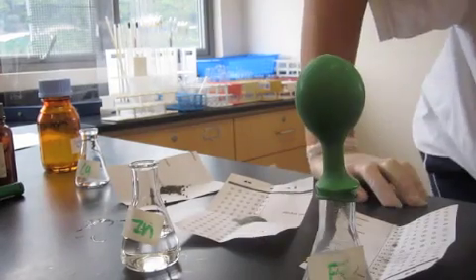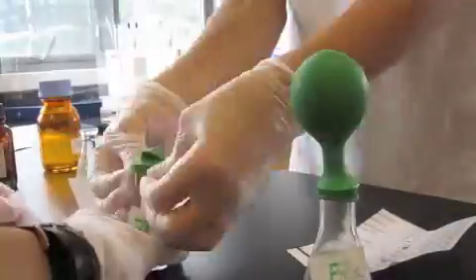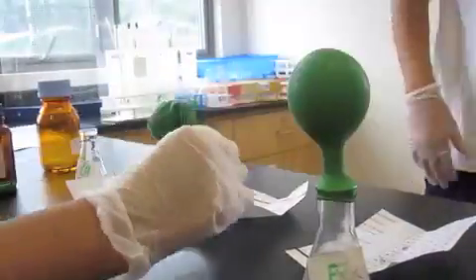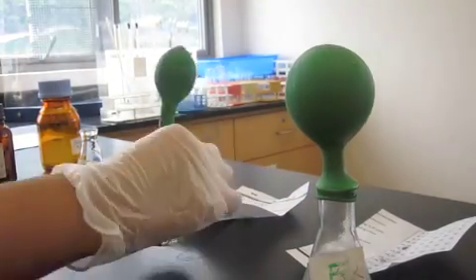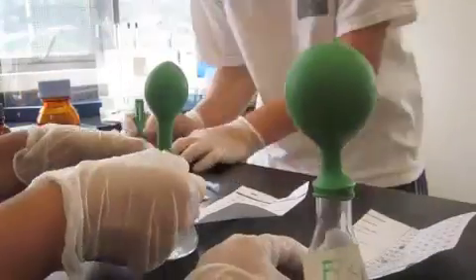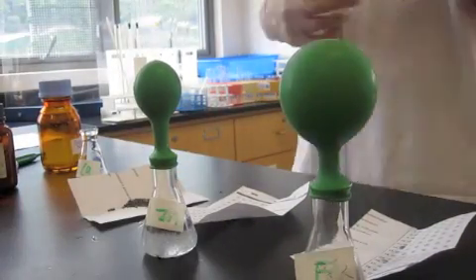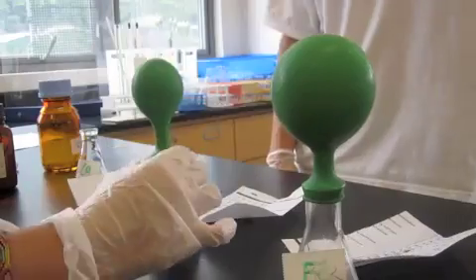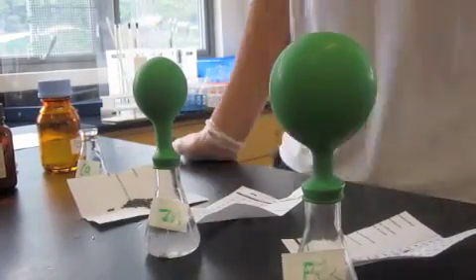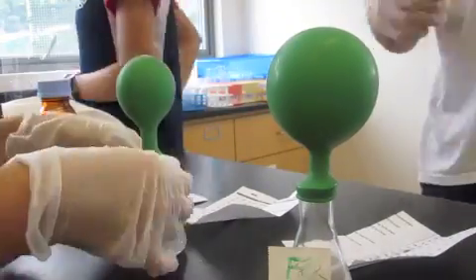From this experiment, it was determined which car metals were more corrosive. We learned that powdered iron corroded the most out of the three metals when added to H2SO4, followed by powdered zinc, and finally calcium pellets. It could be then concluded that based solely on our experiment, calcium produced no reaction. Therefore, according to our results, calcium pellets should be used to construct cars. However, calcium reacts violently with water. Therefore, theoretically, zinc would be the best metal to make cars out of.